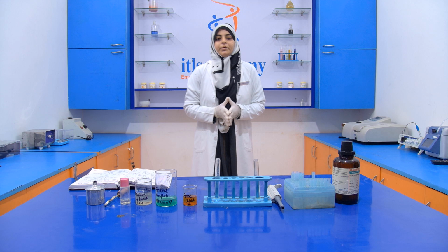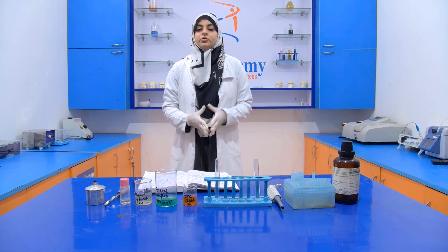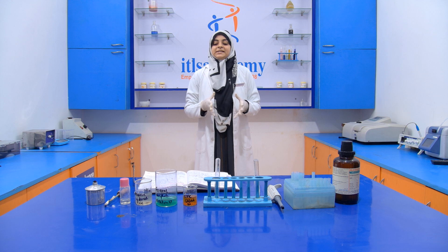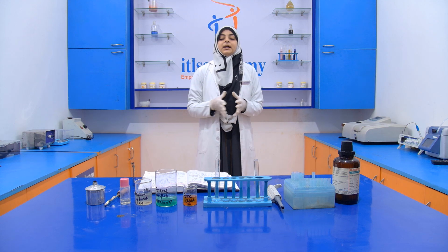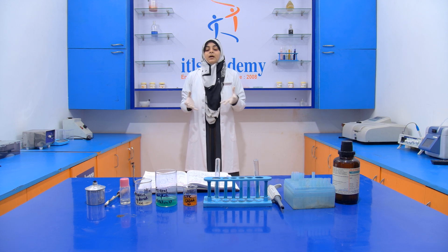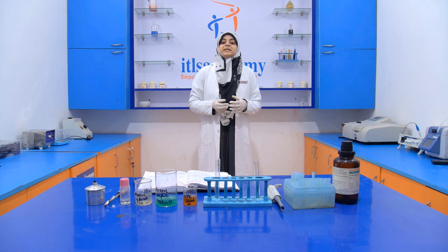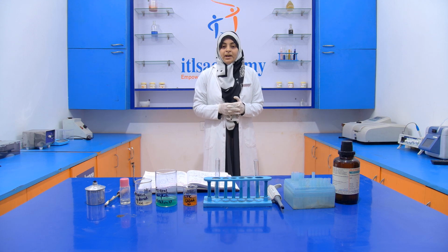Today we are going to perform another experiment, that is the detection of cyanide in an edible oil. This experiment comes under the series of the detection of adulterants in edible oil.